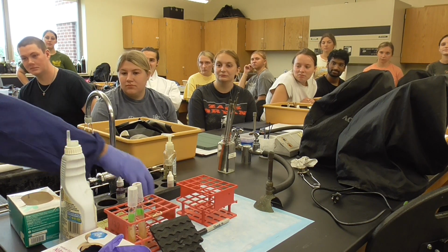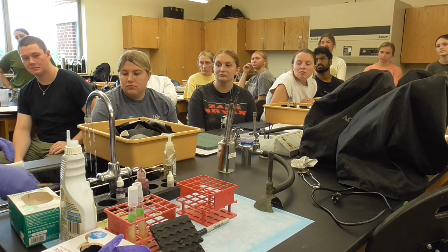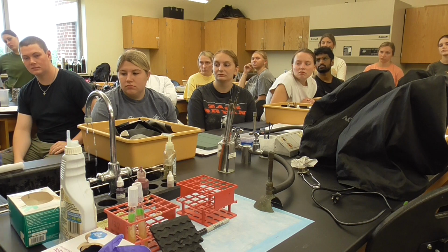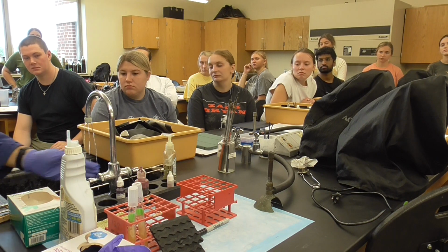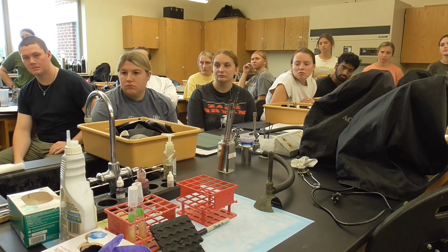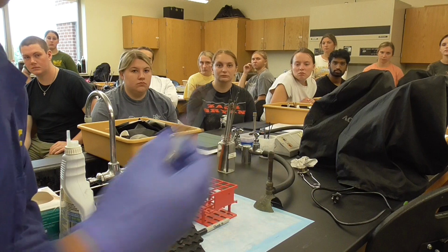Then what you do is you're going to do the rinse. So after, let's say, 1 minute is ready, we're going to do the rinse. Just do the rinse. Okay, then we go here. Then we cover it. Turn off the water. That is pretty much ready to go. Okay, so you can see you smear kind of like that.